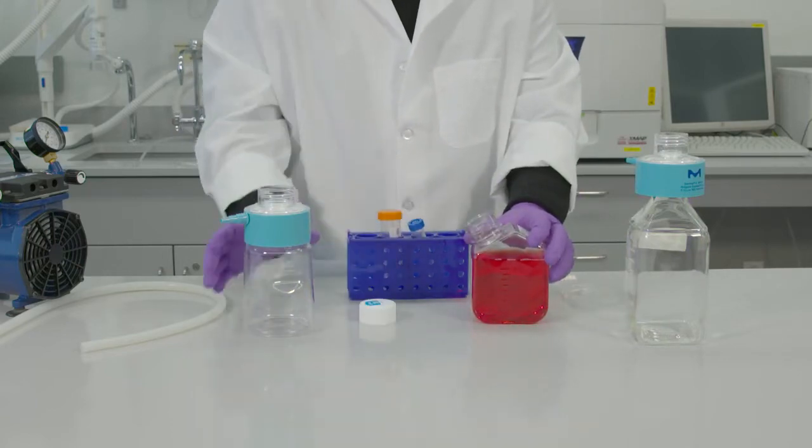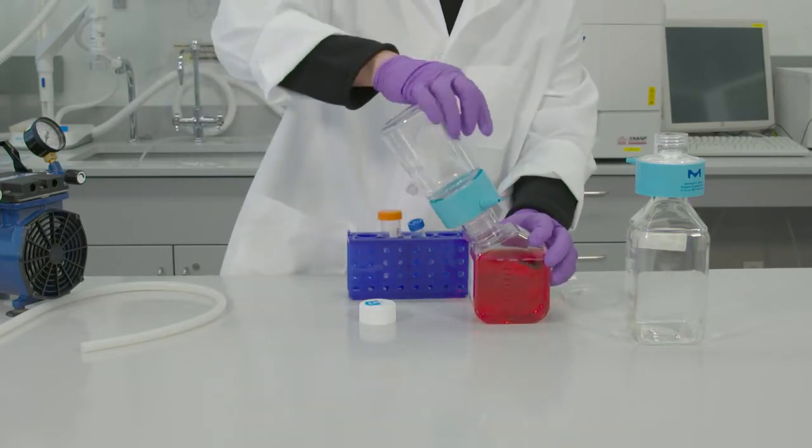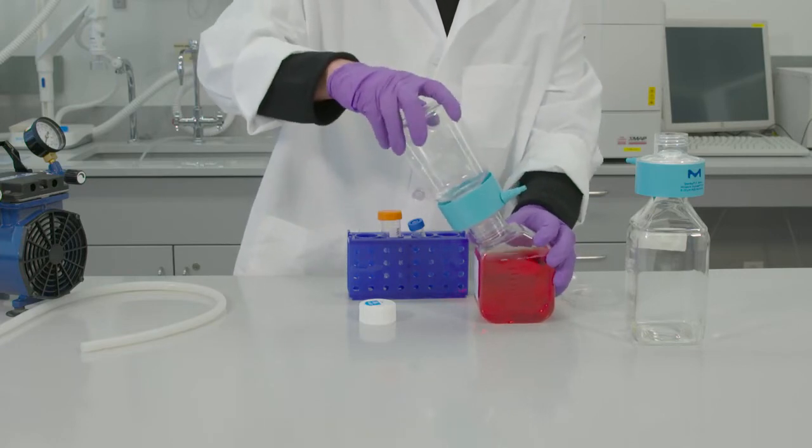Attach the SteriCup E to the media bottle using the domed collar coupling. Screw to tighten the connection.